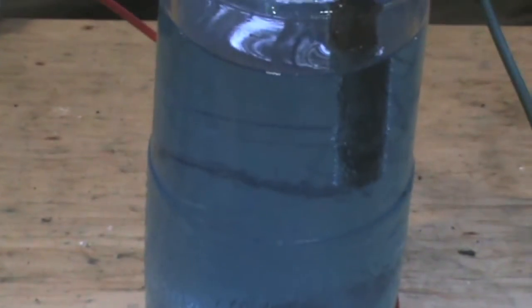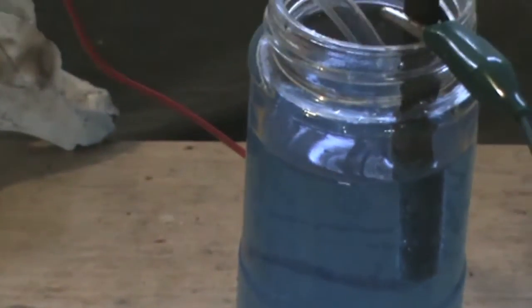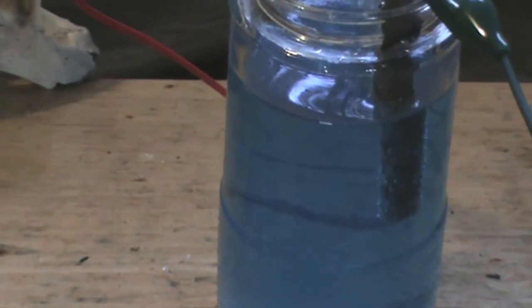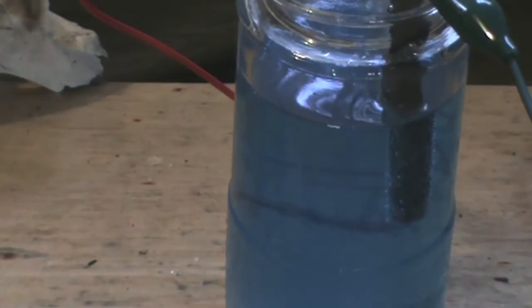Welcome TDC viewers! In this video I will be converting an aqueous solution of copper sulfate to sulfuric acid by electrochemistry.